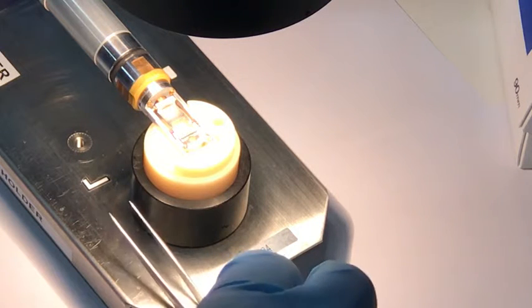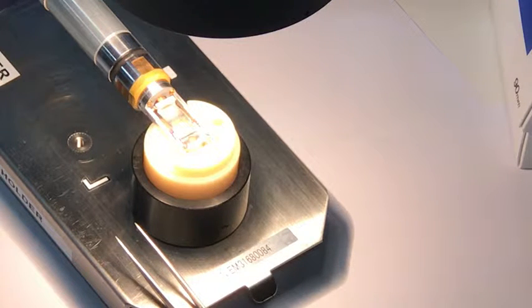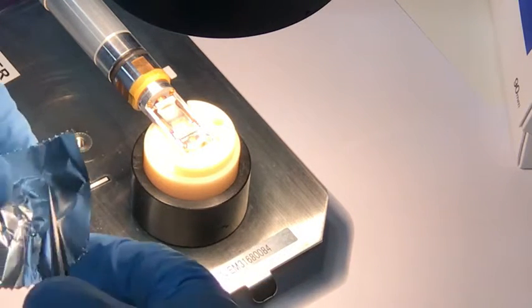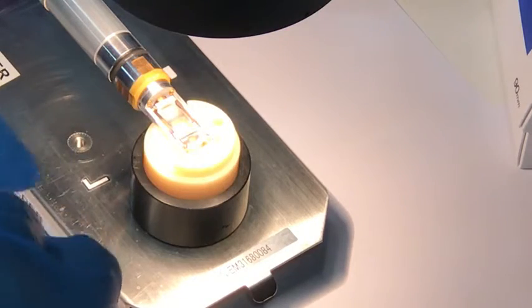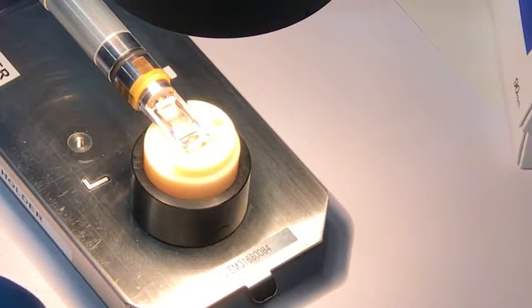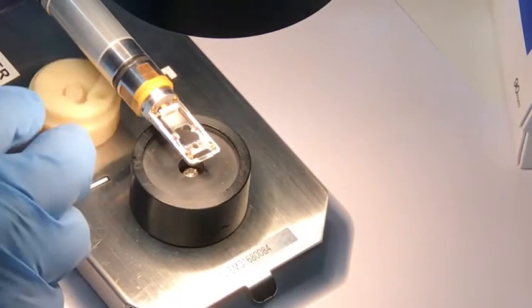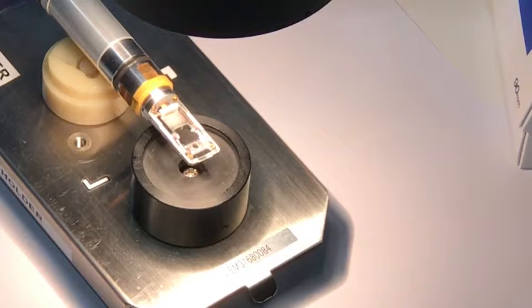I'm going to cover these tweezers with a bit of foil. Fresh foil. Stop dust and dirt getting on the tips of the tweezers. Helps reduce the threat of contamination. It can go undercover. And now we're ready to move the specimen into the pumping station. Alright, so that's that done. Specimen is unmounted.